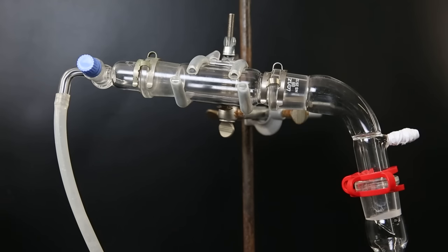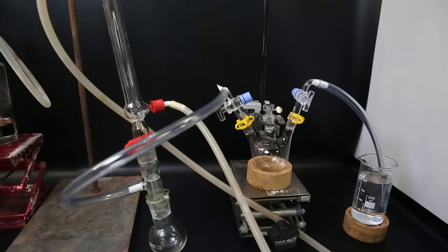Then it will go upward to this small straight column adapter. In this adapter I will put the tin, so the chlorine will react with it. Then any tin 4 chloride vapors will go down towards the condenser, condense, and drip down into the receiving flask.